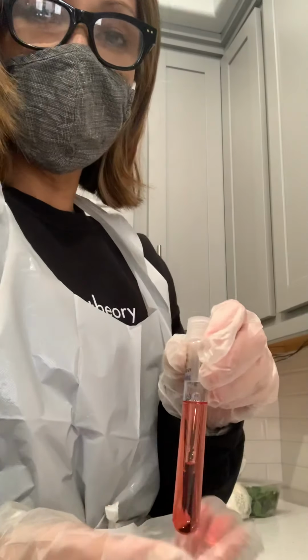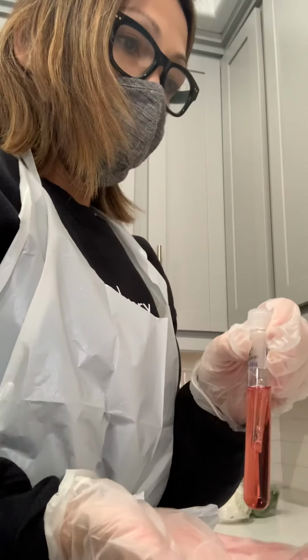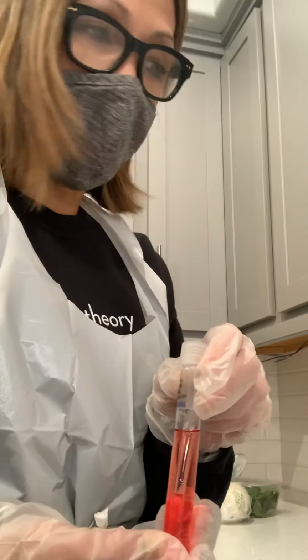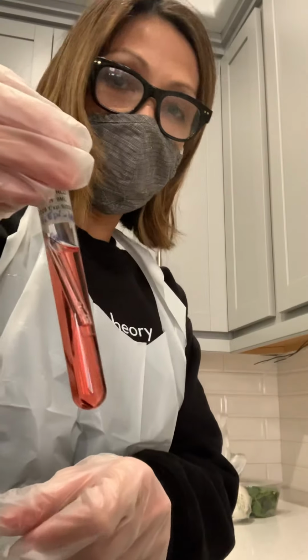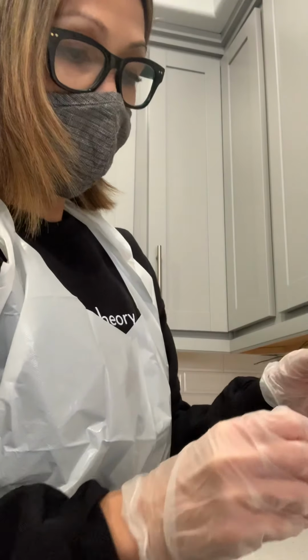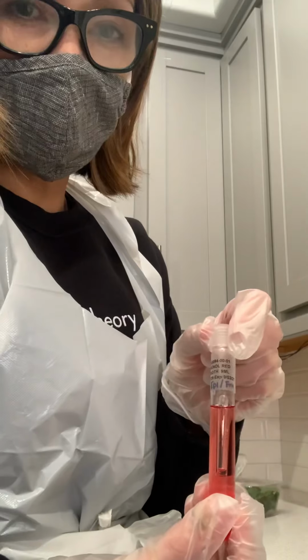It means that the organism does not utilize carbohydrates. That's why it's still red right here, and that's for the glucose. It's the same thing for the fructose. So it's still negative for the epidermis.